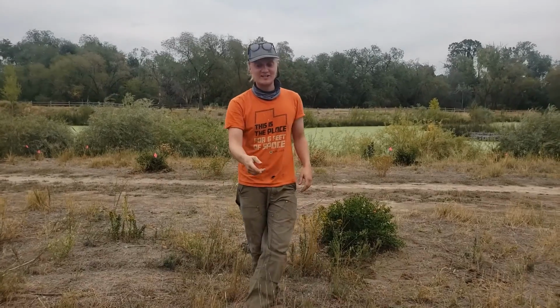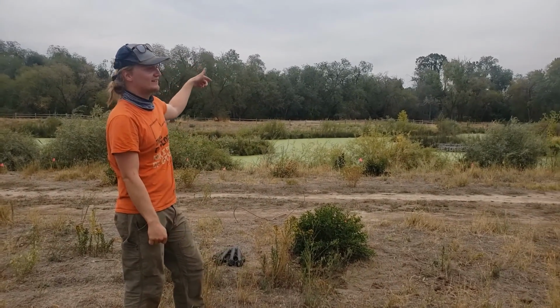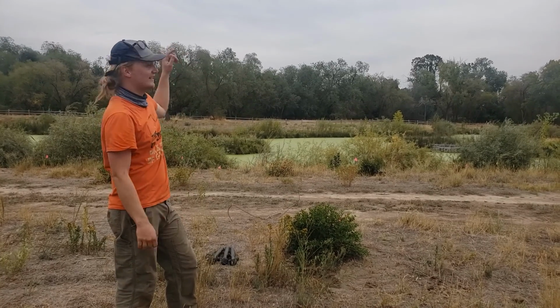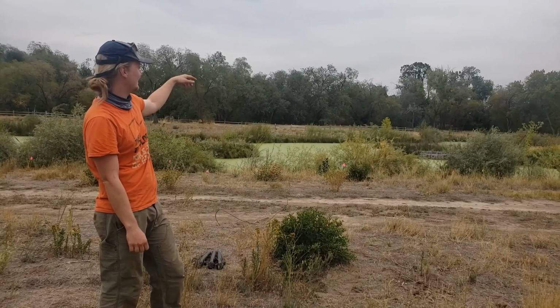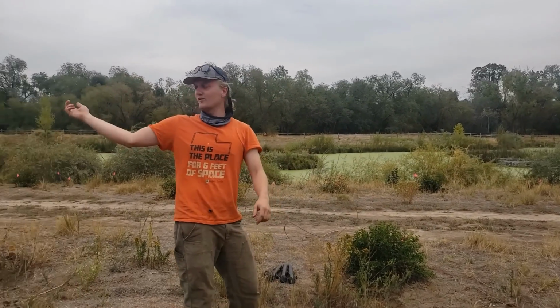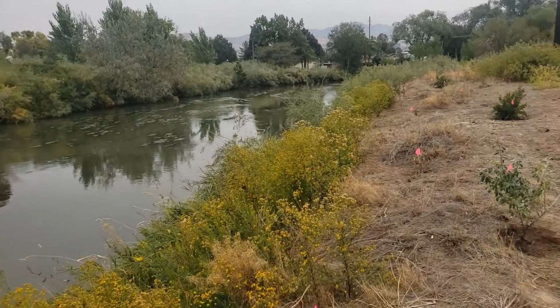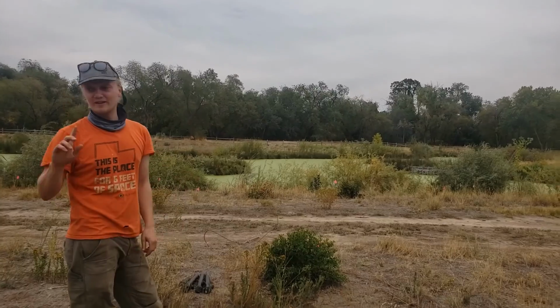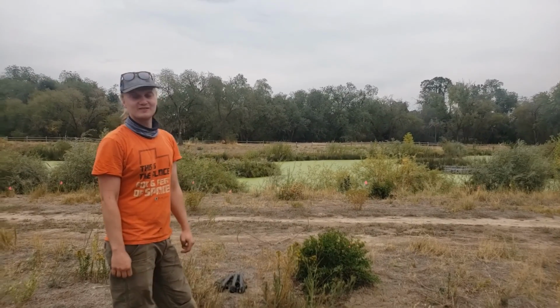Oh, cool. So I was just curious. Yeah. We're collecting water from the Jordan River in this pond at the Fife Preserve, and I'm curious to see what the results are, because this water, the Fife Preserve's lake, the stream has a big oxbow right here, comes around all the way around this way, and the water that's in this lake is coming from the Jordan River that loops around this way. So I was just curious to see what the different results are.